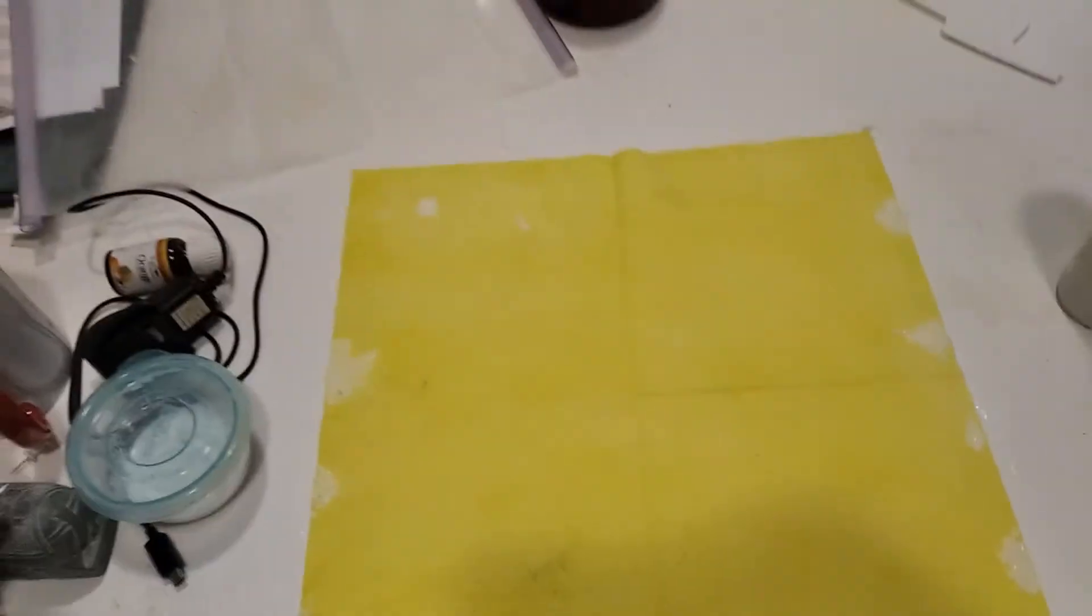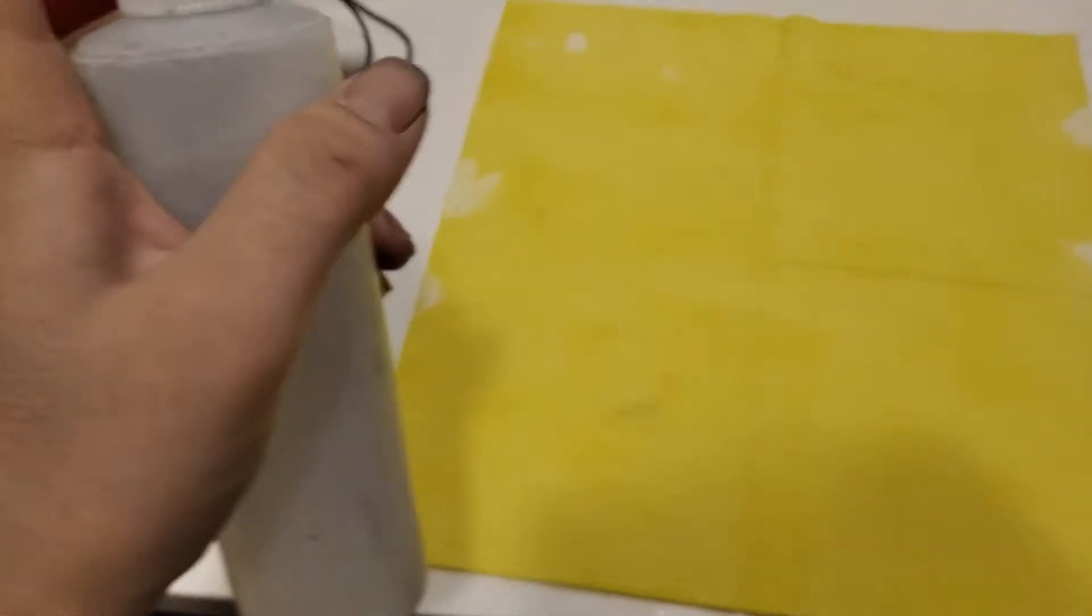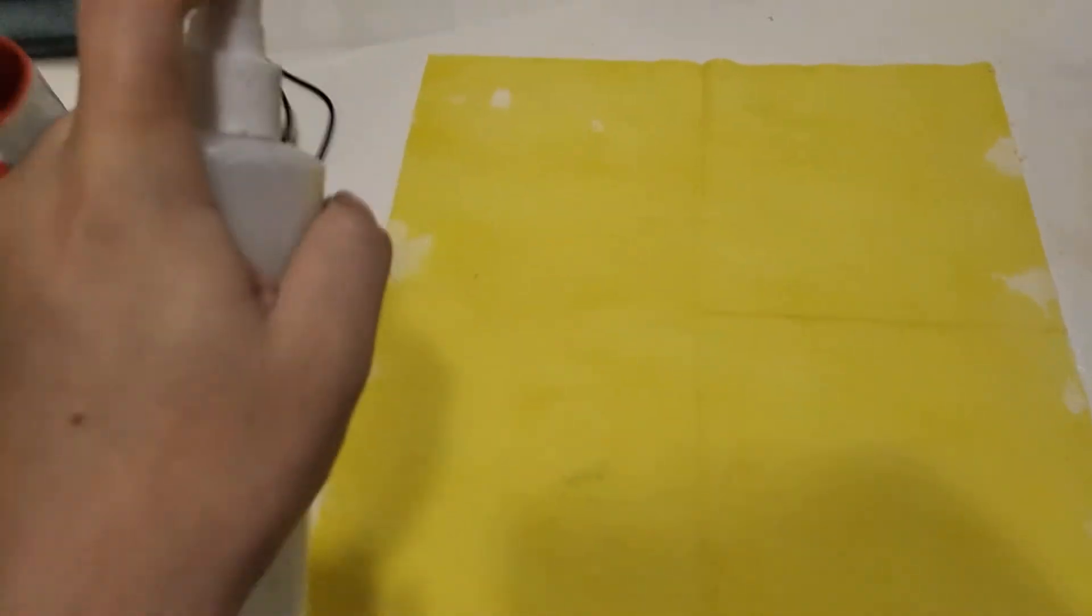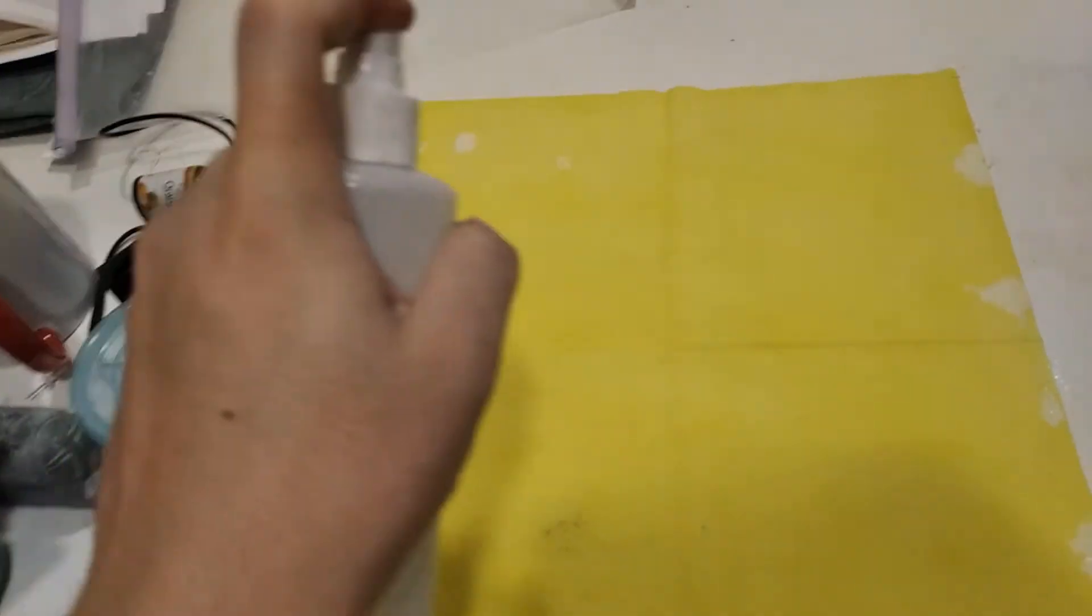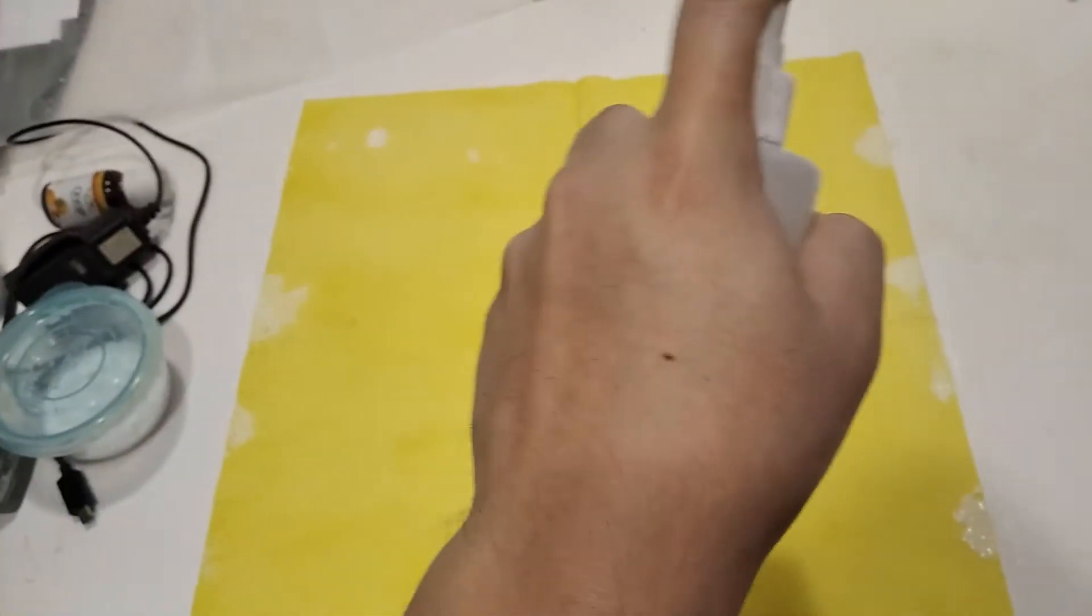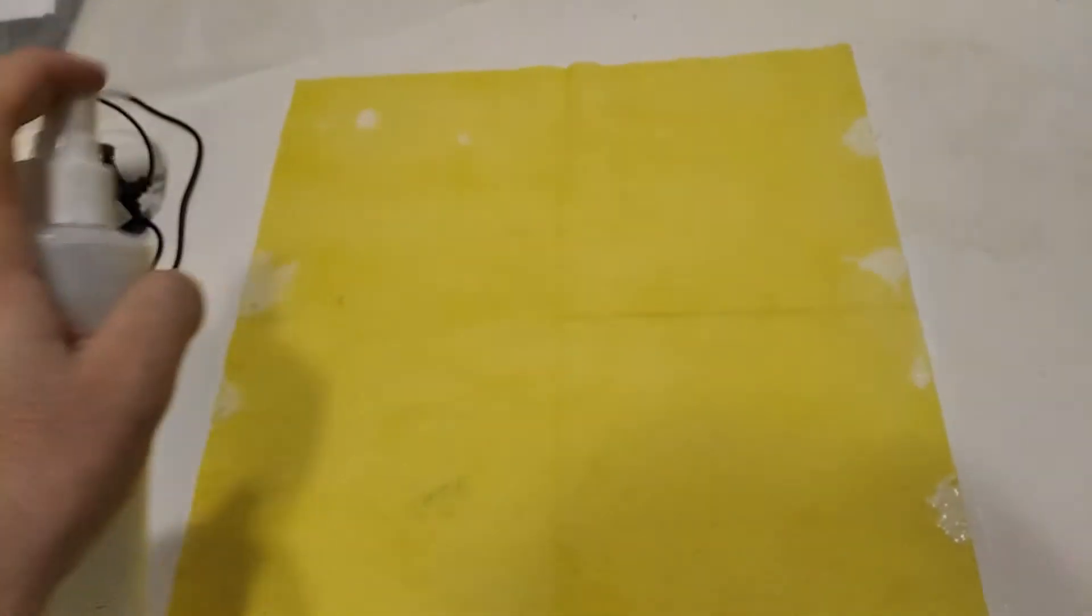Now the most important step is to cure it. This is only your first coat. You're going to do maybe five or six coats, or three or four depending on how much you want. Take your sodium borate solution, shake it, then apply it through the entire surface.